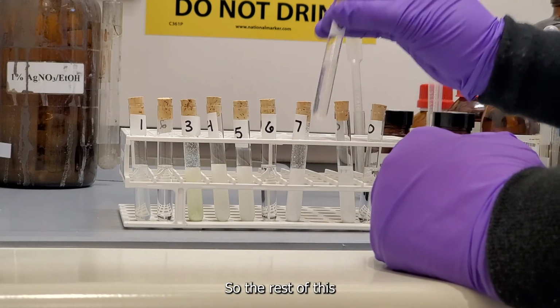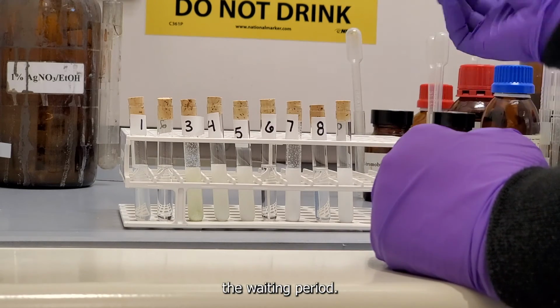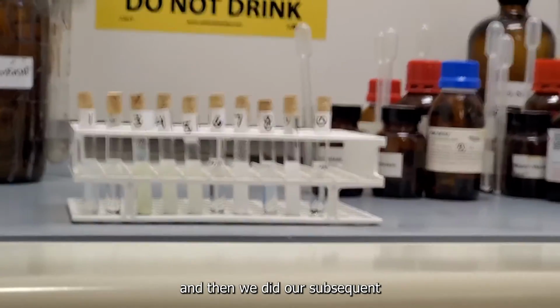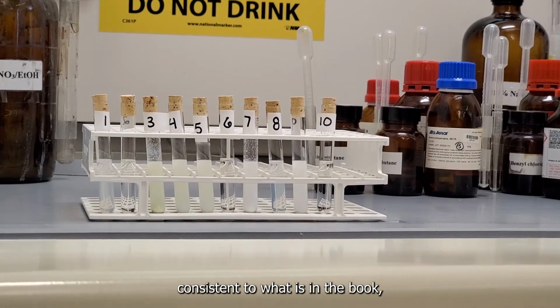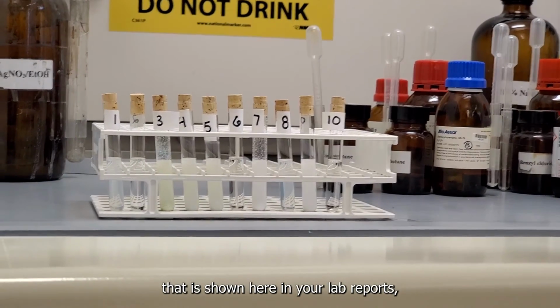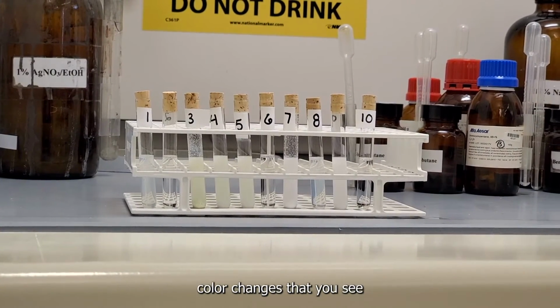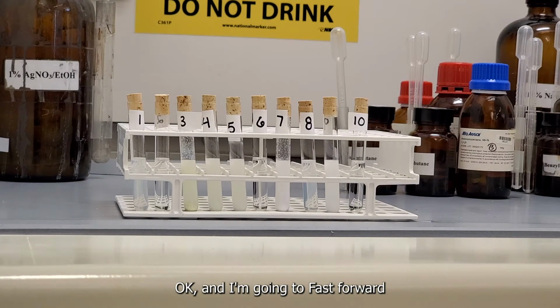So the rest of this portion of the video will be fast forwarded, and we're going to show you the waiting period. One thing I want to point out is that we've changed our waiting period to 10 minutes, and then we did our subsequent heating reaction. I want to point out that we've kept the labeling consistent to what is in the book, so you can actually write about the precipitate that is shown here in your lab reports, and this information will be useful. So keep note of this, and keep note of any color changes that you see, as well as the precipitate. Okay, and I'm going to fast forward the next part of the video.